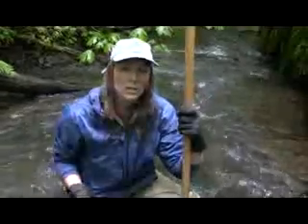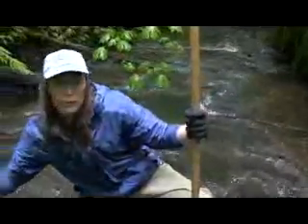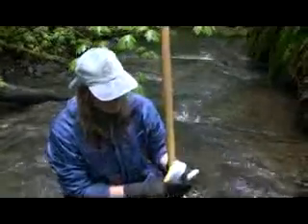Another thing that you can do just to give yourself an idea of approximately where you're going to sample is you can make yourself some kind of a little frame or use a ruler, and you're going to place it down on the stream bottom where you can see it. So once you've got the idea of how much space you'll sample from, you're going to want to first of all remove the larger objects out of your way.